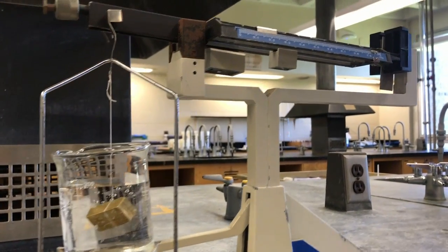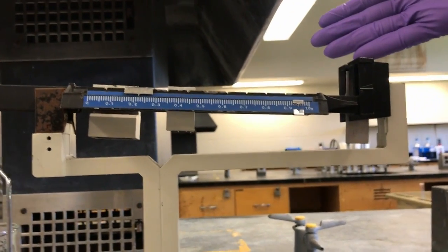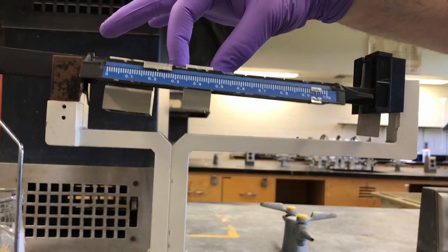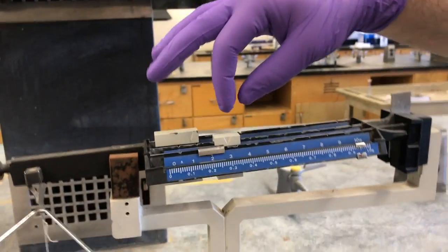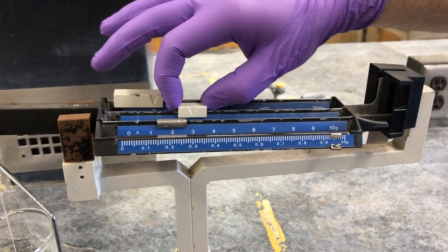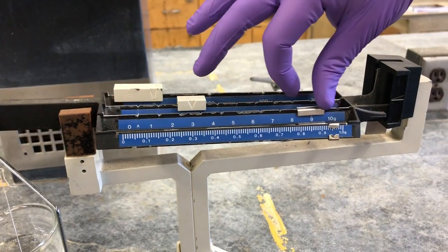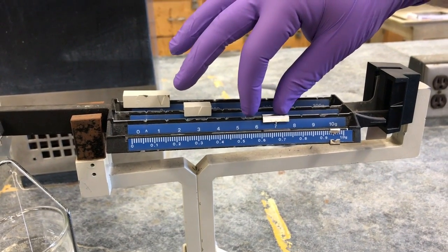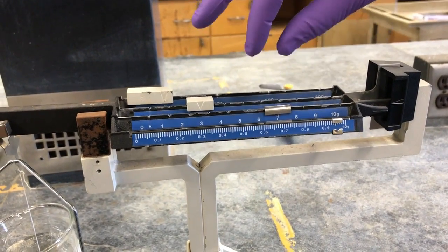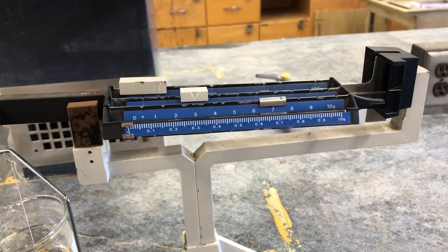And as you notice now, the scale reads that the mass is too heavy, so we have to lower these balances. So I'm going to do that now. At 40, this mass is too heavy. At 30, it now moves up, so we know that at least it's in the 30s. So let's try moving this to 7, 6. Oh, let's try 7. Move your lowest one all the way to the left, maybe. Oh yeah, don't forget that.